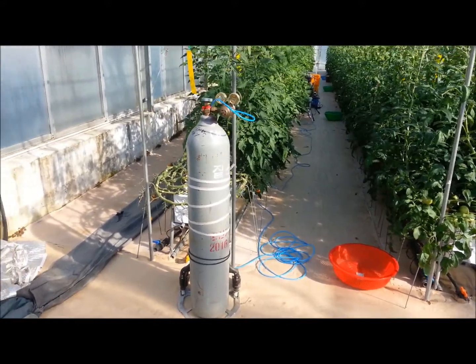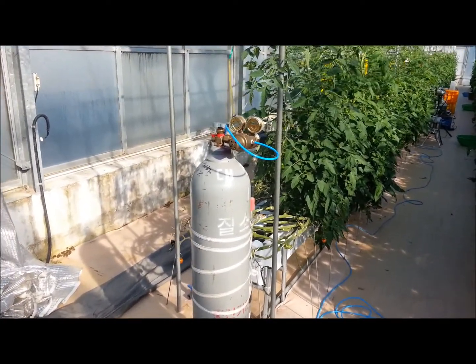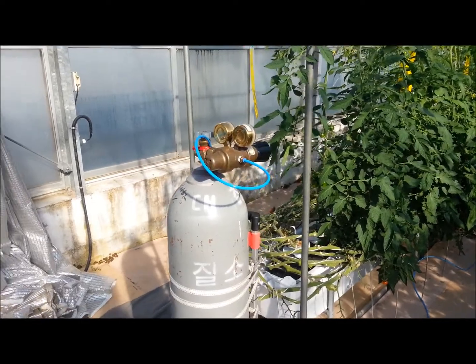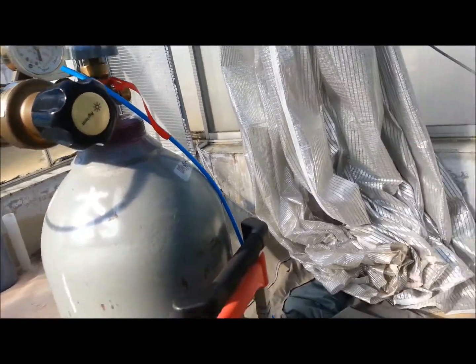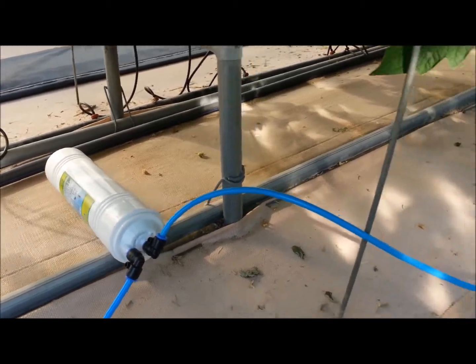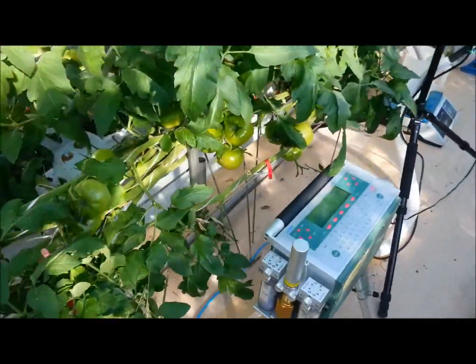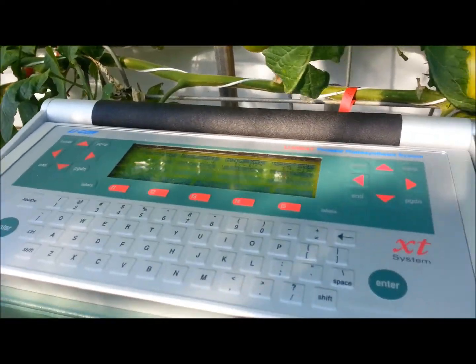Here in front of the screen you can see the tank for 98% nitrogen plus below 2% oxygen concentrations. This tank is connected to the air tube, passing through the moisturizing filter, and connecting to the LiCor LI-6400XT.